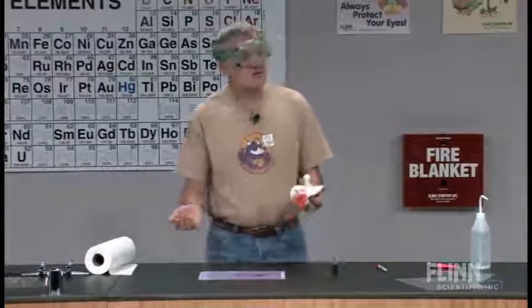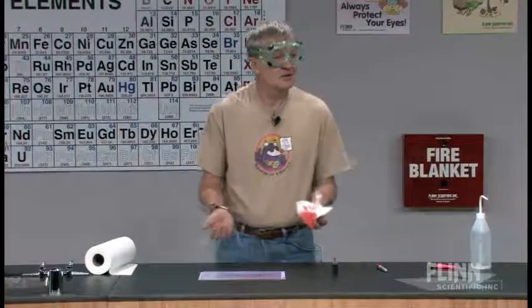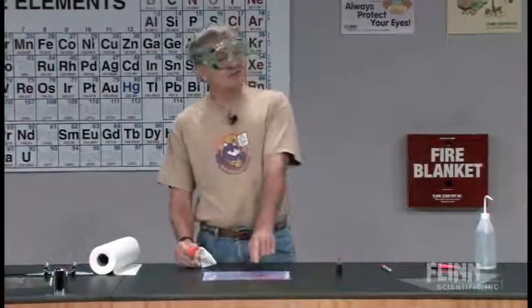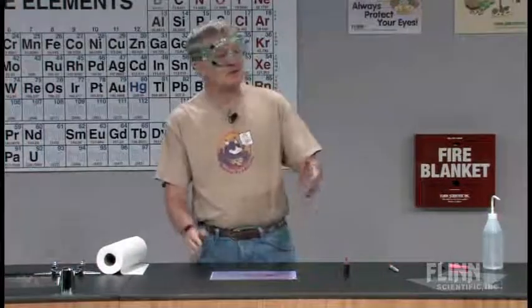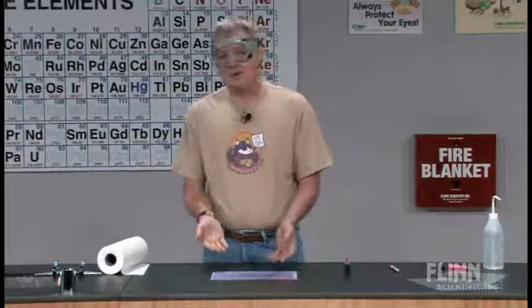Now, realistically, unless your eye wash station has like zero pressure, or if the lens has been fused to the eye, it's going to blow that contact lens out as soon as you put your face down in there. But still, it does show that this can be a problem. At this point, I can then talk about the fact that if you're wearing contact lenses in the lab, we're working with volatile chemicals. It's conceivable but unlikely that maybe something will get caught underneath there, even with safety glasses on.